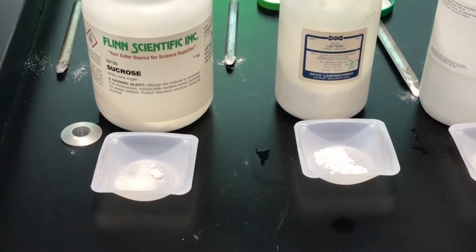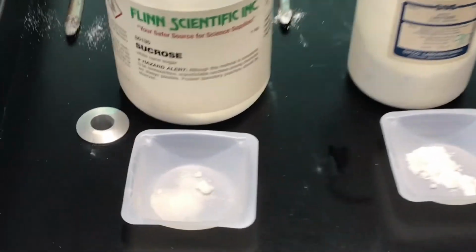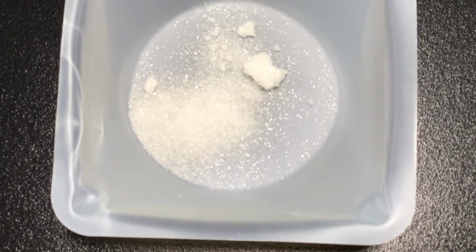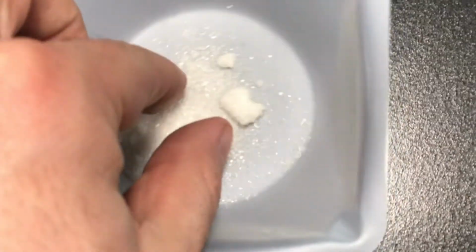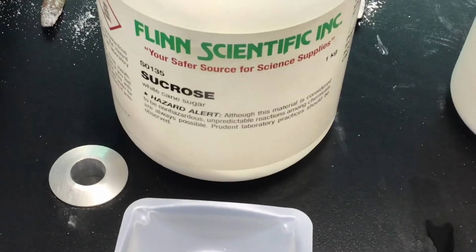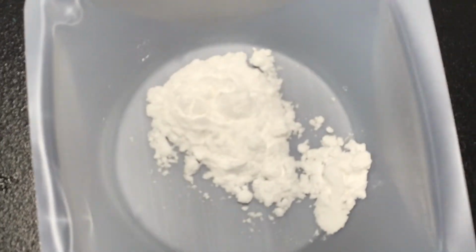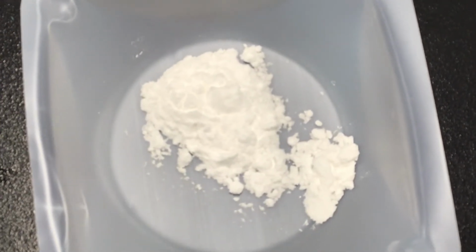Finally, let's create a physical description of each of the substances. First is sucrose. Sucrose is table sugar. So we could see that sucrose is white and granular. It's grainy and the color is white. Let's say white and grainy, white crystals. That is sucrose. Lactose is more powdery. It's like a white, fine powder. So for lactose, we could put white, fine powder.